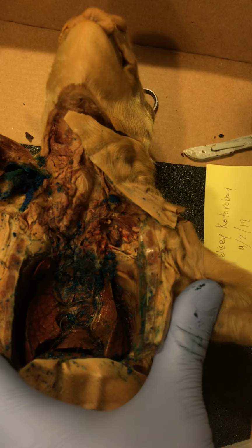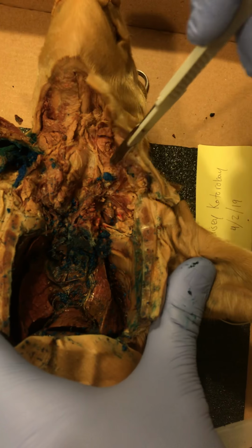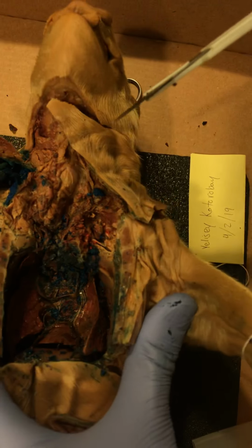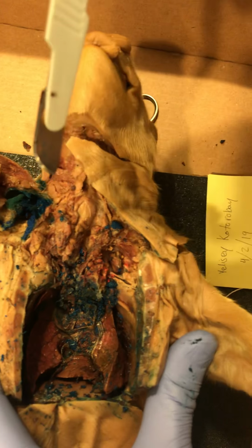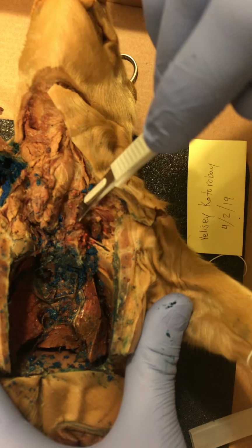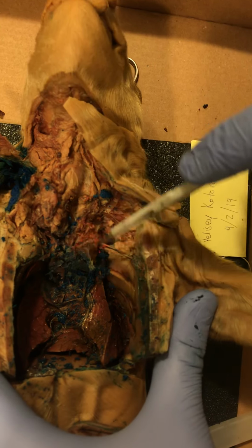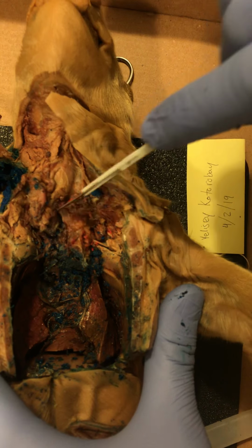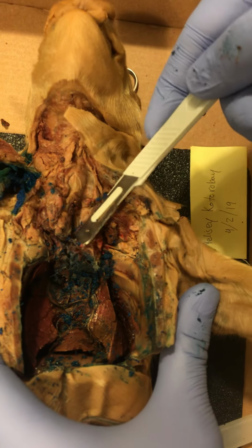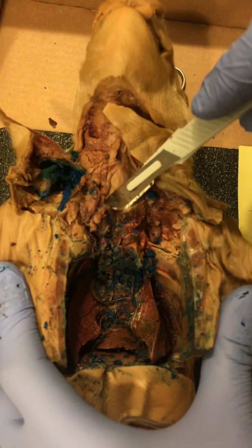Alright, from the top, the first photograph is going to be the one that includes the region and area of the larynx, which is always on top, and the trachea, which is on the bottom. The trachea has some softer tissue here. Let me see if I can peel off some of the softer tissue and the connective tissue.